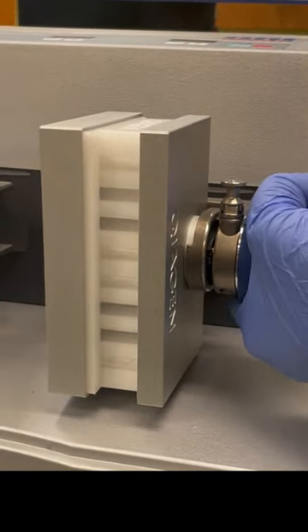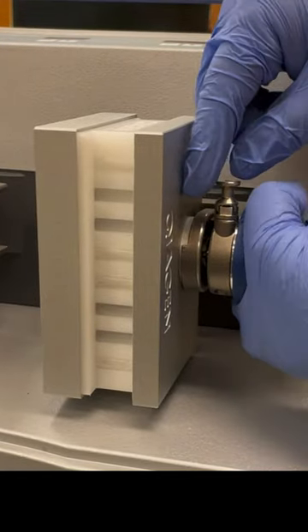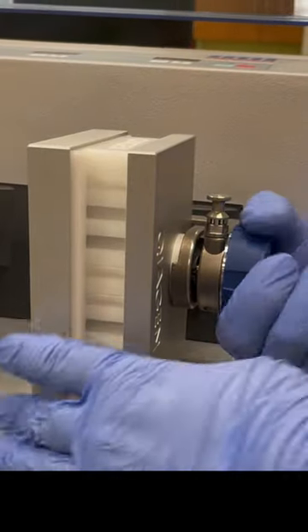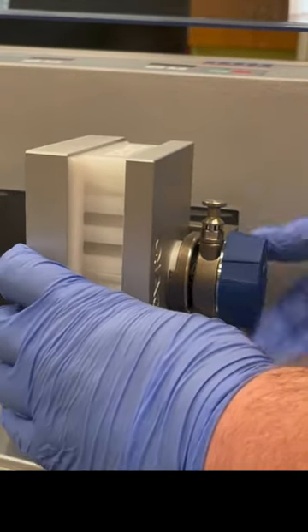When we try to reverse, as you can see this is stopping because the safety is engaged. So if I tighten it a little bit, pull it out, and leave it outside of its grooves, then I can lefty-loosey loosen it just fine.